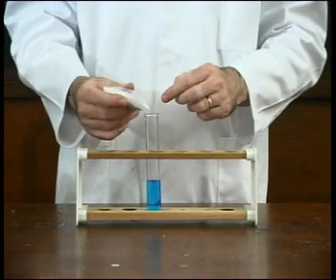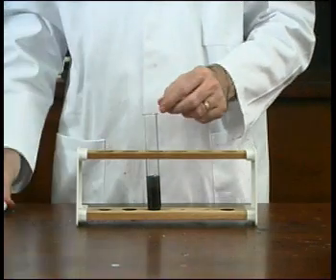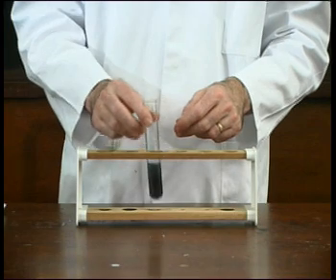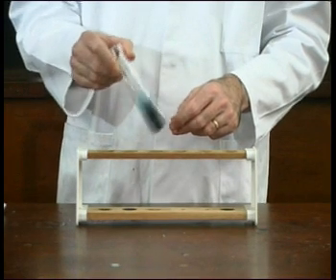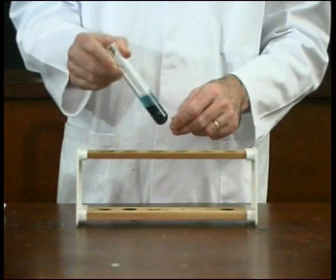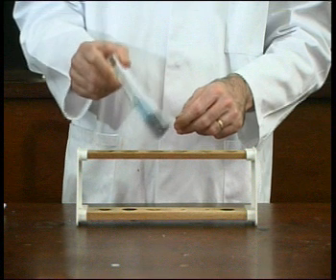When the zinc is added to the copper sulphate solution, there is a reaction. After a time, the blue copper sulphate solution turns colourless and the grey zinc powder turns brown.